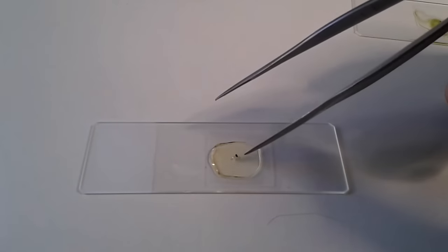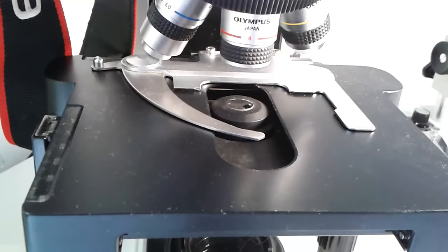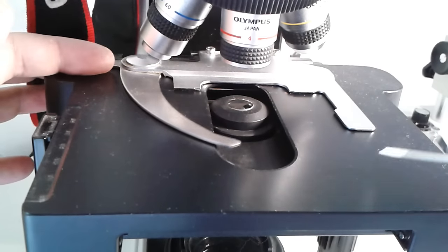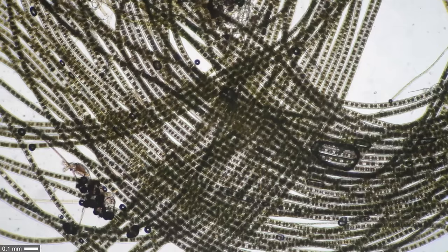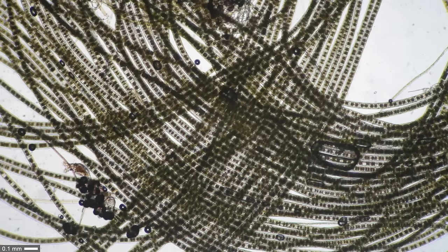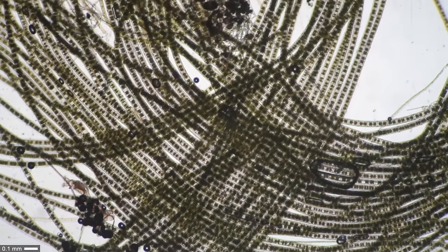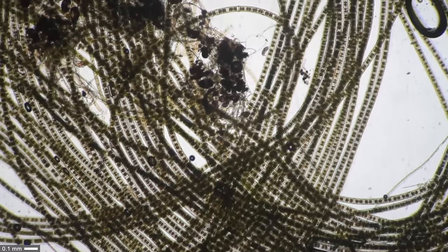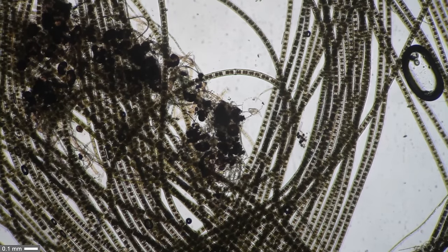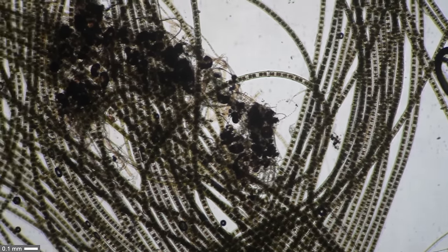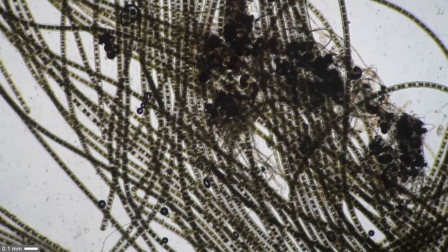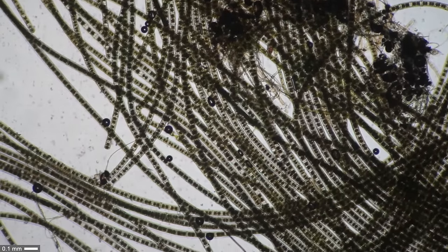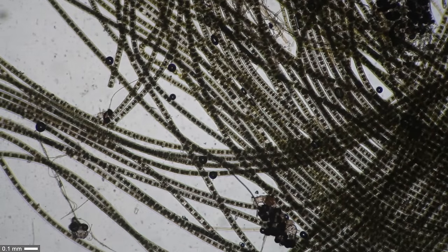The real thing I was interested in are the algae. I'm putting the slide with my algae under the microscope now. Let's have a look at low magnification. Yes, there are plenty of algae. On the lower left side, you can see a little scale bar. There are a few ciliates also moving around between the algae. Higher magnification is going to be more interesting here, so I'm switching over to higher magnification now.